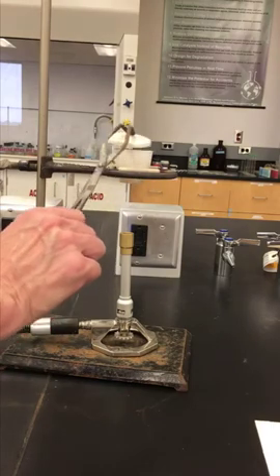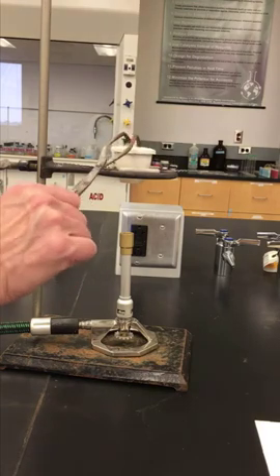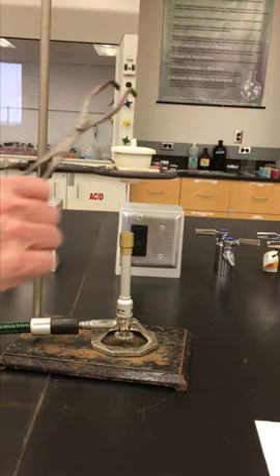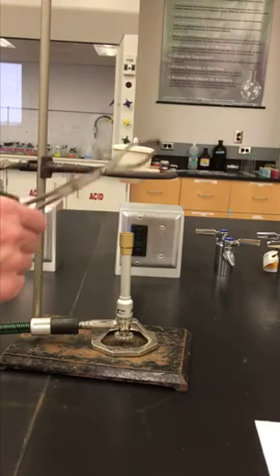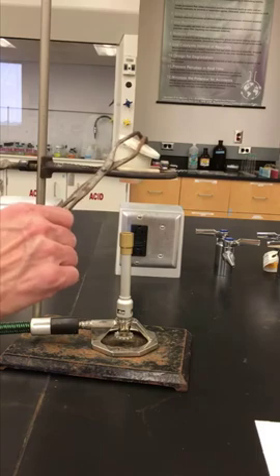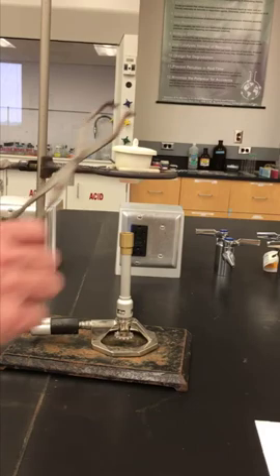A lot of this is patience. You're going to heat it up. It might start smoking. After a while you will see no reaction. Be aware when you're a scientist, you're looking at observation. So observe, what does the magnesium look like before you heat it? And then we're heating it with oxygen. We're doing a combination reaction. So we're combining magnesium with the oxygen. What does the new compound look like? What are the different properties it has than the magnesium alone or the oxygen alone? So periodically lift the lid. Starting to heat up. It's definitely glowing red. But I don't see any reaction occurring yet. You will see it start to smoke a little bit. Like that. When it starts to smoke, I'm going to just lift the lid a little bit and put it right back down. I'm not even going to take it way off. But I do need to have some oxygen in there.